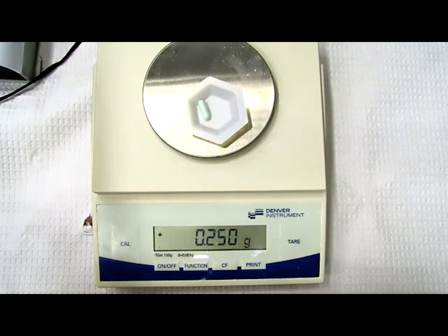249 milligrams. So the QA weight would be 249 milligrams. And she would continue to do that until all 6 capsules have been compounded. Should there still be some extra powder left? There should be a little bit because we calculated for 10, but trust me, it disappears.